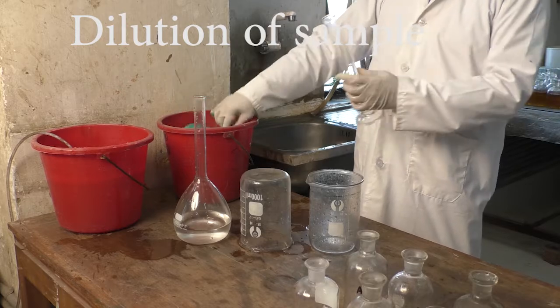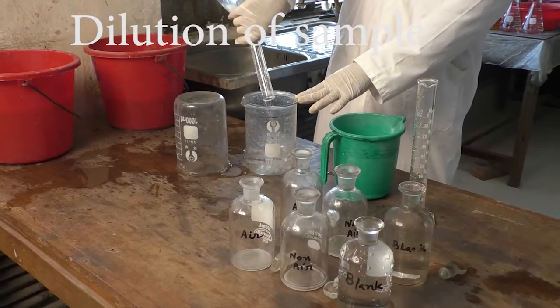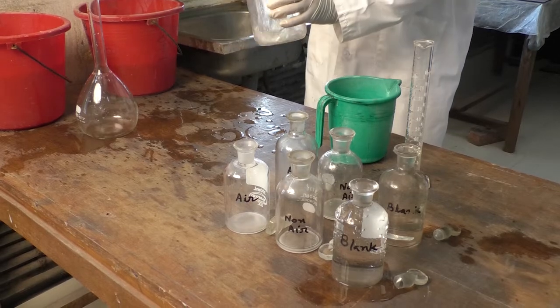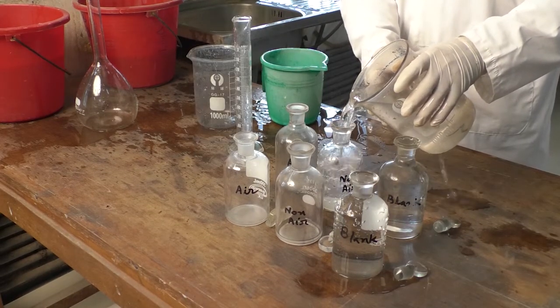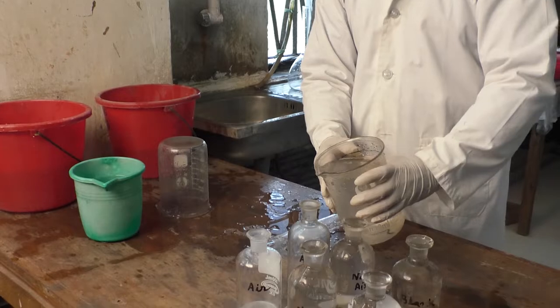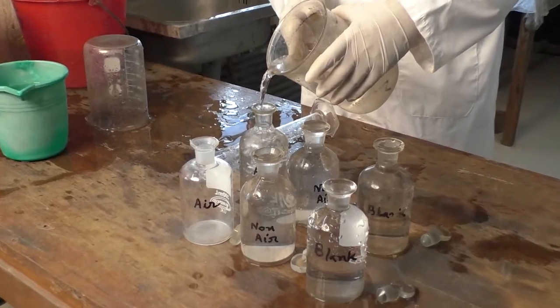Then we will dilute the sample by mixing it with the dilution water. The dilution ratio will depend on the level of the BOD in the sample. After dilution, the BOD bottles of non-aerated samples will be filled up with the diluted non-aerated sample, and the BOD bottle for the aerated sample will be filled up with the diluted and aerated samples.